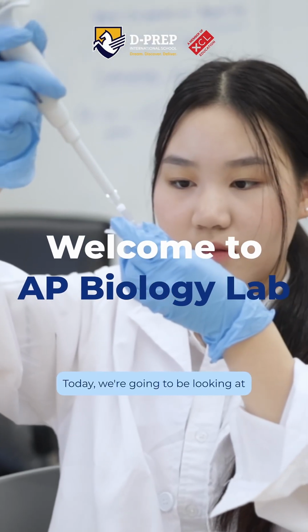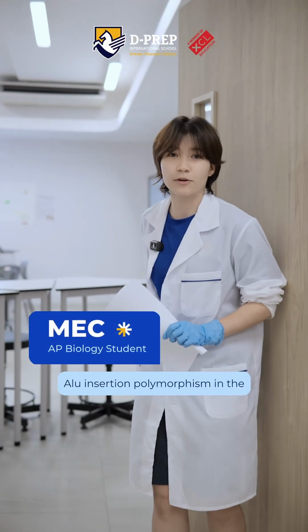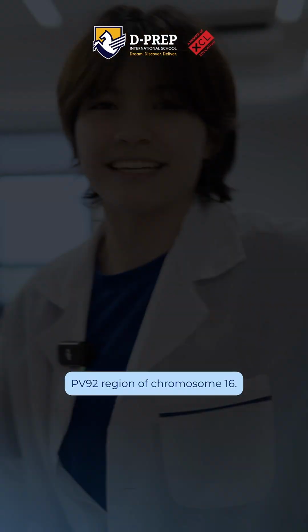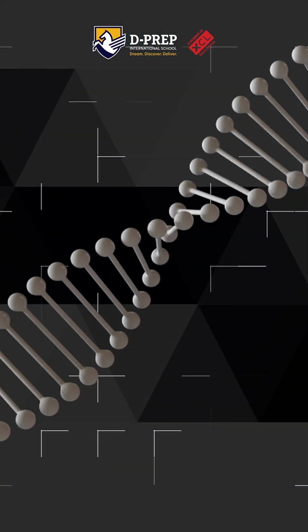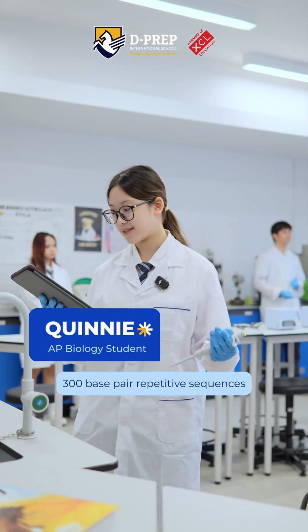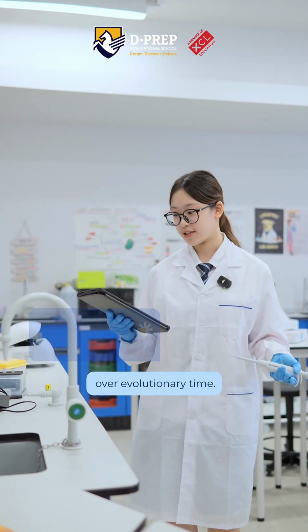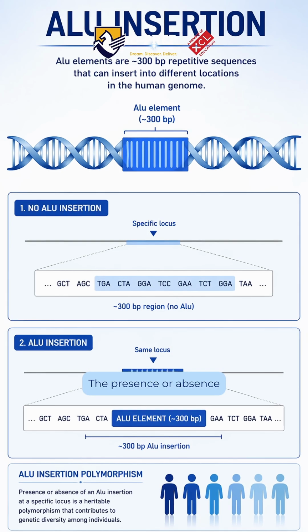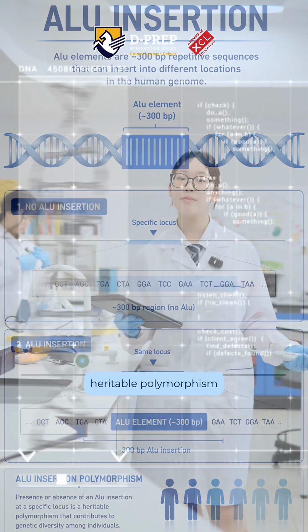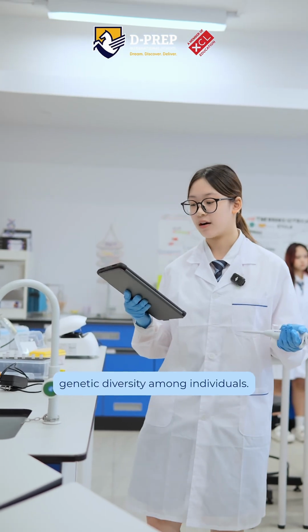Today, we're going to be looking at human genetic variation by investigating Alu Insertion Polymorphism in the PV92 region of chromosome 16. Alu elements are approximately 300 base pair repetitive sequences that have propagated throughout the human genome over evolutionary time. Presence or absence of this element at a specific locus represents heritable polymorphism that contributes to genetic diversity among individuals.